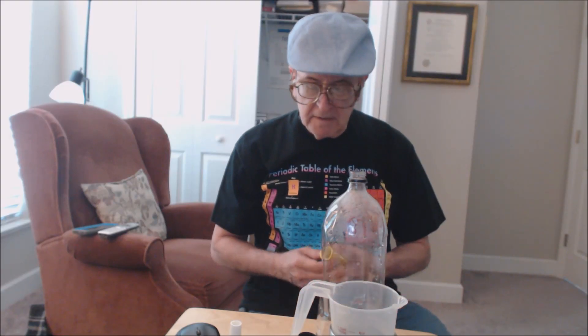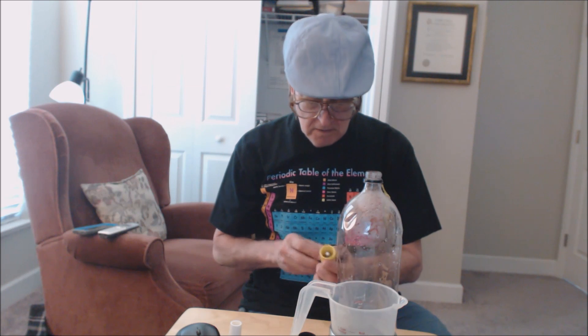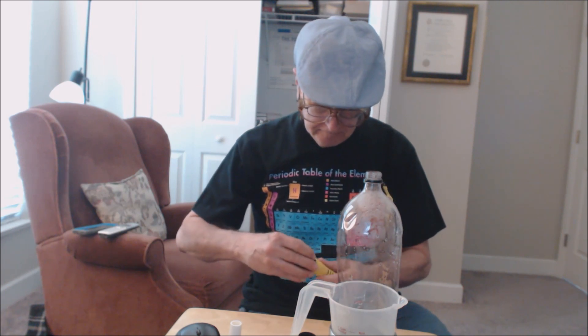Hello again. I'm going to make another attempt at doing the carbon dioxide sequestration. I'm going to use a soda bottle — it's a little more flexible — so I'm going to put the canister in here. We'll fill it up with carbon dioxide, and as I said before, if you have a tank, you have the luxury of a tank of carbon dioxide.